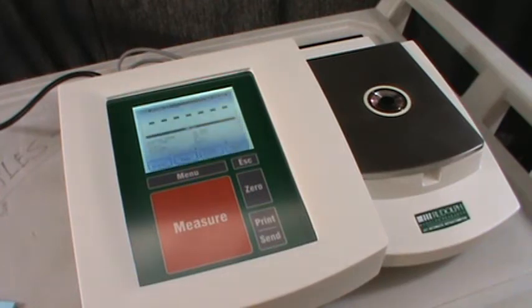For this video a J57HA is shown; however, the functionality is the same for a J157, or electronically a J157KBP or PTW, though with these models the sample is poured rather than placed under the prism.